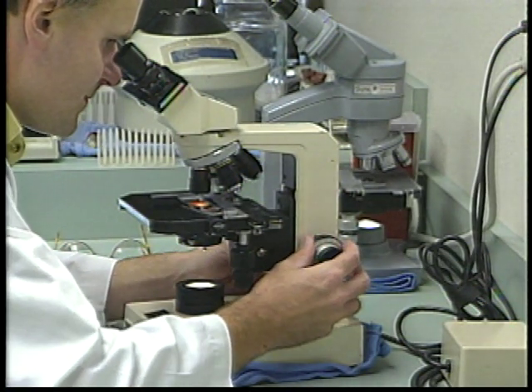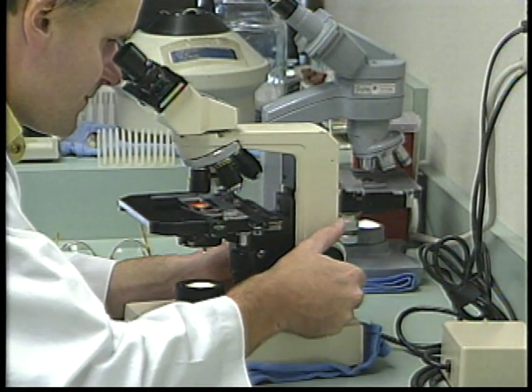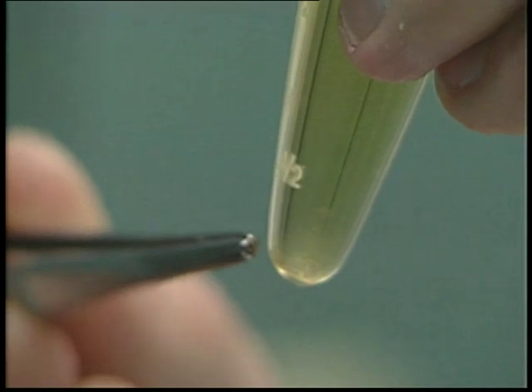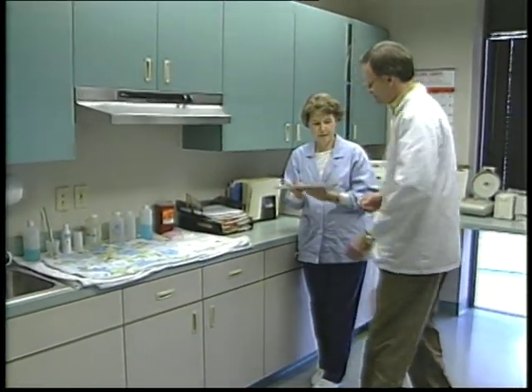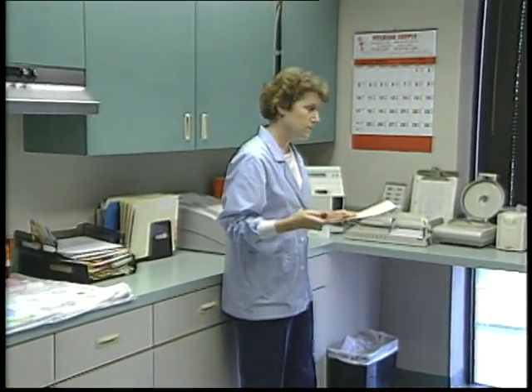As mentioned at the beginning of this program, there are many other laboratory skills you will inevitably be taught. Your introduction to working with blood, urine, and fecal samples should, however, provide you with a necessary foundation to help you be a valuable asset in uncovering the mysterious diseases and problems many of the pets may present.